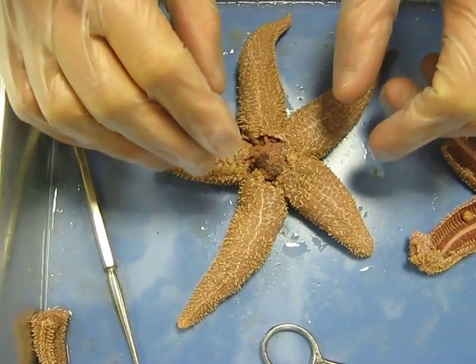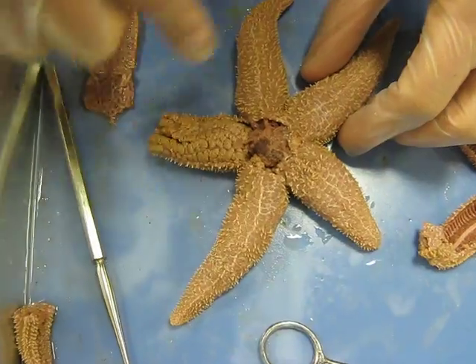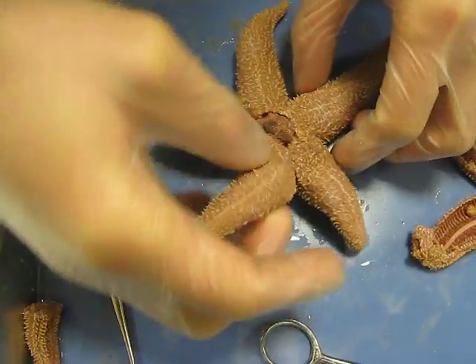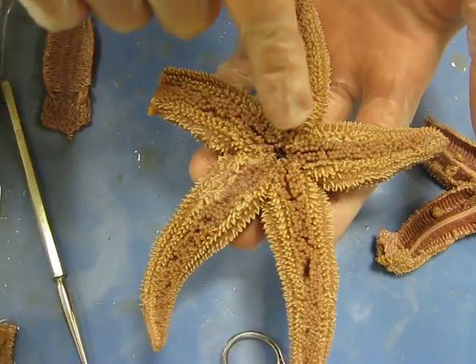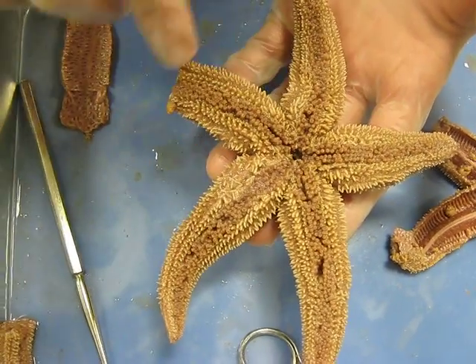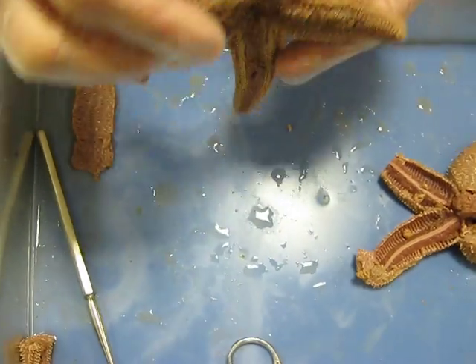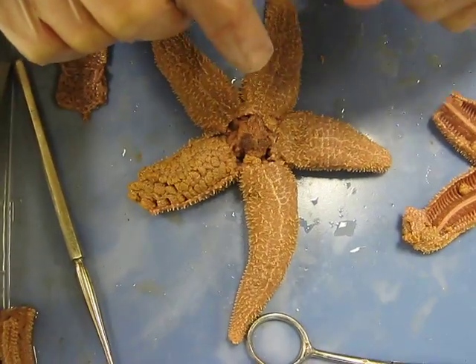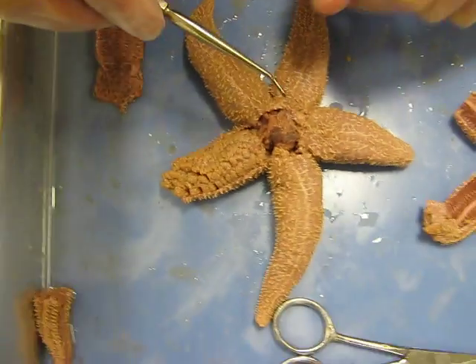This is the starfish Asterias. This is the aboral side and central disc, and underneath is the oral surface with the mouth and tube feet. The eye spots are on the end but we can't really see them. Back on the aboral surface you have the madreporite right here — that's where the water vascular system enters.